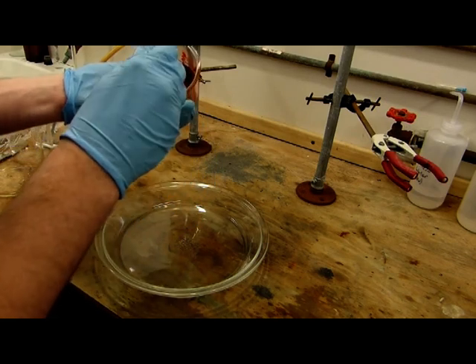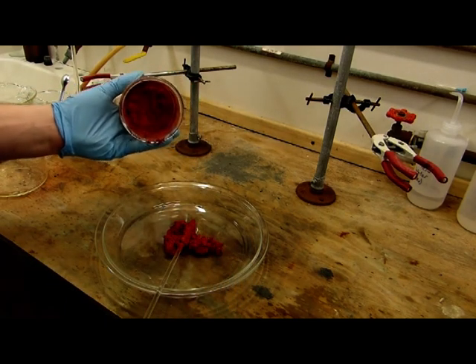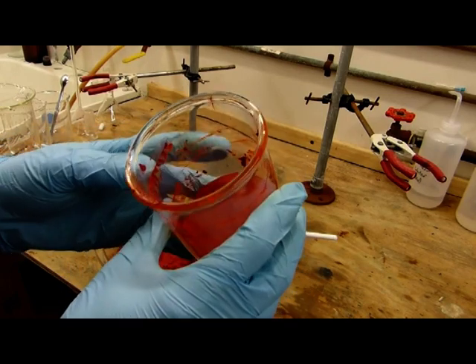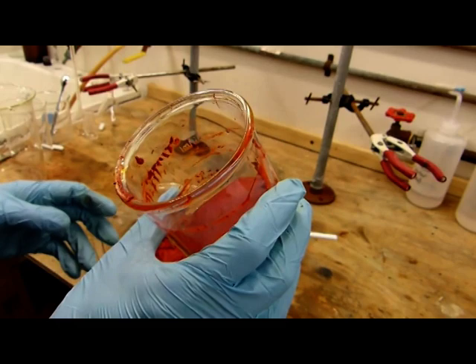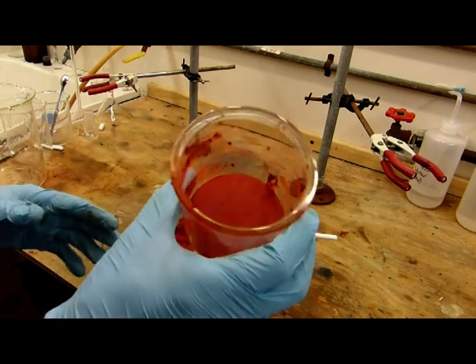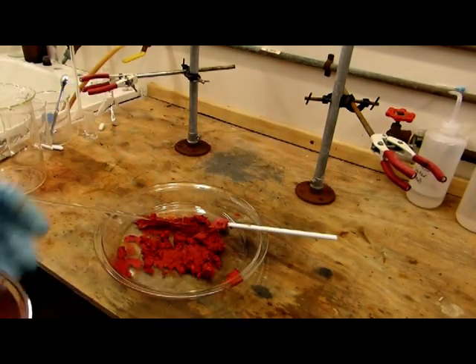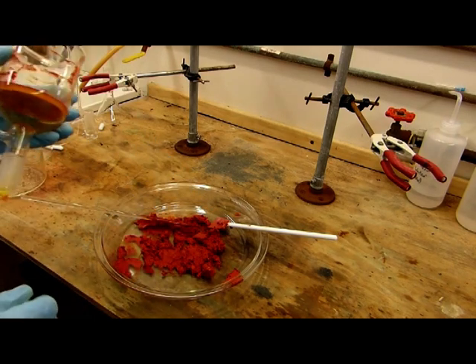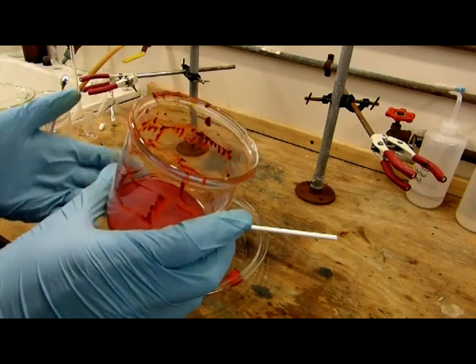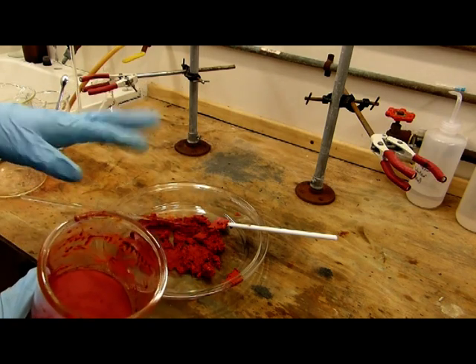I think I've got as much as I can out of this. You can see the crystals were pretty fine, so it sort of clogged up the filter here, and I got quite a bit out of it though. I'm kind of happy with that, but I suppose I should have cycled the temperature a few more times to increase the crystal size. Next time if I do this, I'm definitely going to do that. I've got a decent yield. I'm going to try and get it off this rubber spatula as soon as possible because it's probably going to eat right through it. This can't just get washed out in the sink. It's full of hexavalent chromium, so it's got to go in a bucket of sodium sulfite solution or something like that first to make sure that you reduce that chromium down.